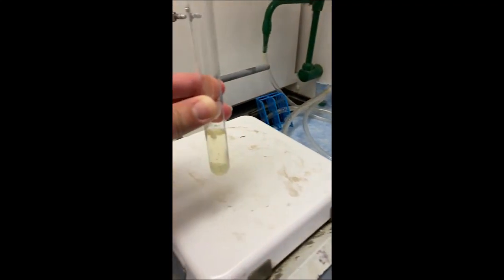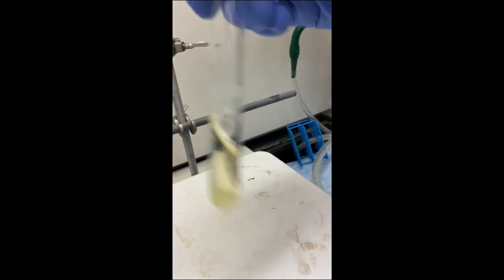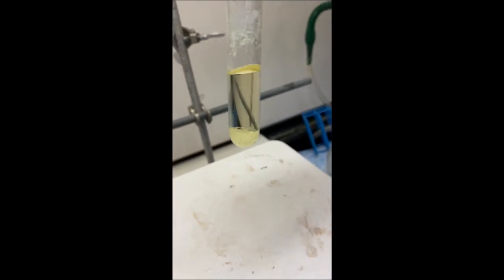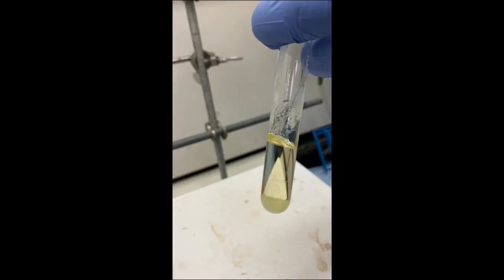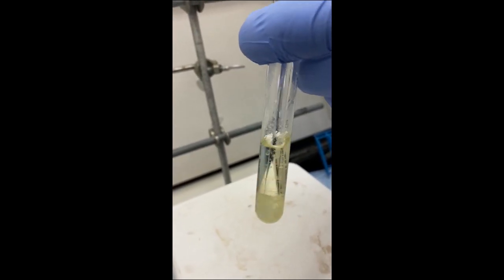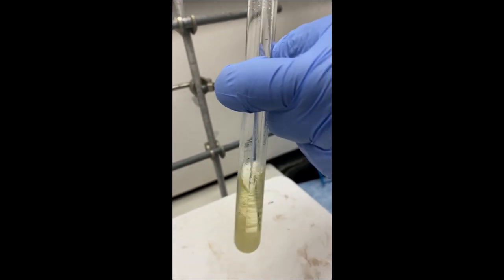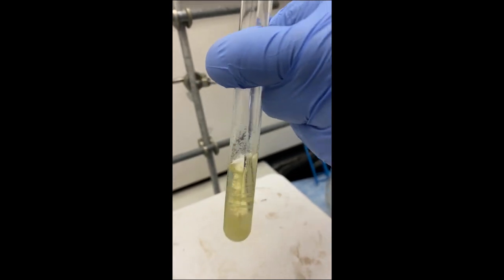You can literally see precipitant forming, and that is your product. Ethanol is pretty polar, and the methoxychalcone is a non-polar substance, so as the product is formed, it literally precipitates out of the incredibly polar ethanol.